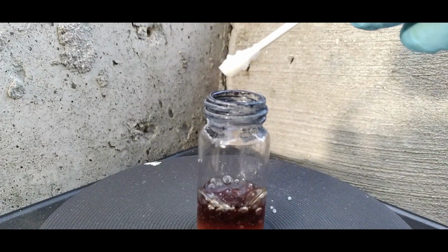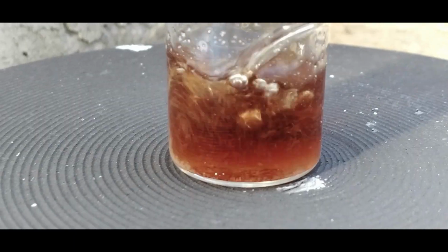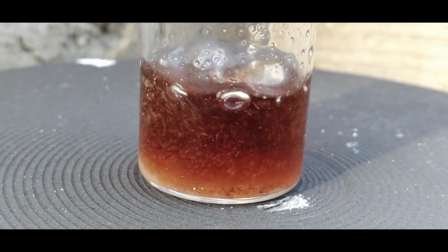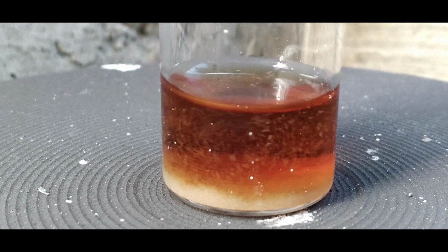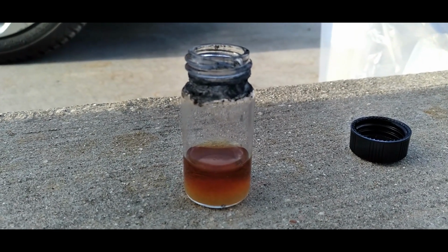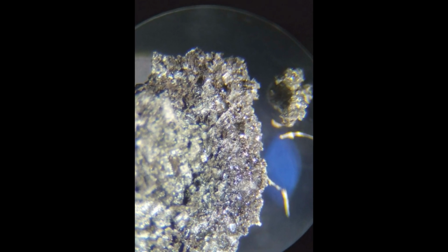It was around this same time that I decided to try and check for osmium tetroxide vapors, but I couldn't detect any. Eventually, as more sodium chloride began to precipitate out of solution, the boiling action became so violent it would cause the vial to jump in the air. Obviously this was problematic, but I made some practical adjustments and soldiered on. Eventually a thick crust began to form around the rim of the vial. I collected this crust as it was rich in osmium dioxide. Looking at it under a microscope, it was indeed sodium chloride crystals chock full of osmium dioxide.